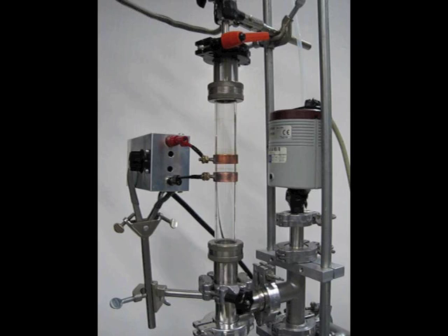You are currently seeing argon gas flowing from the top of the screen down through an evacuated glass tube and out to a pump.